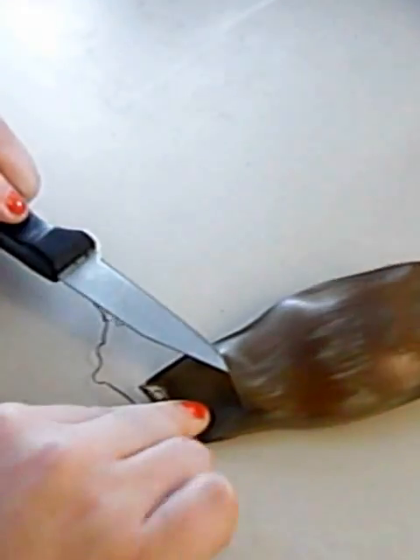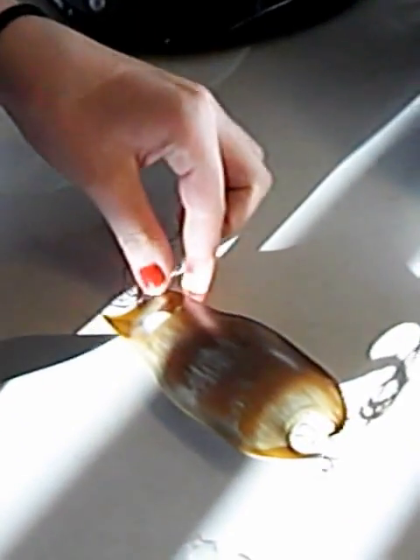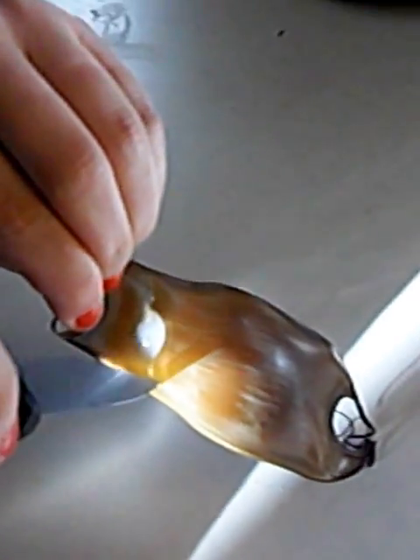Okay, let's just peek inside. Oh god. What is that? Oh god, that's so gross. I don't know if I can do this. We already started it — you have to. Jeez. Looks like mucus. I thought it was just water, but it's like gooey, and that's what's freaking me out. Okay, I'm gonna hold it this way so if it starts to drain, it's not on me.